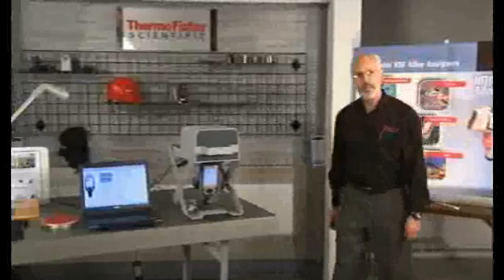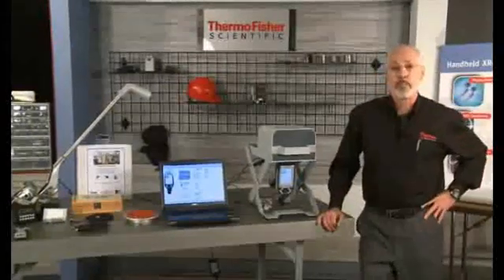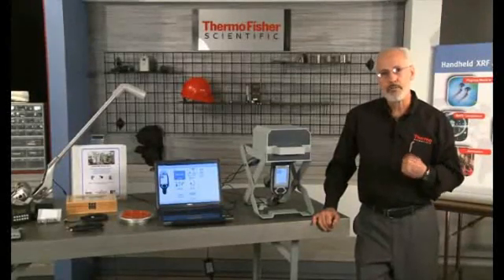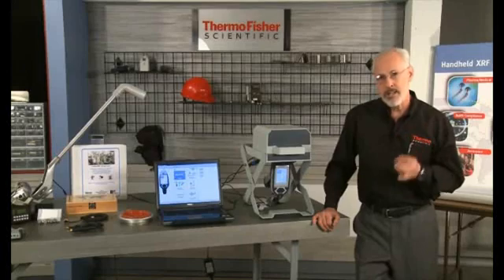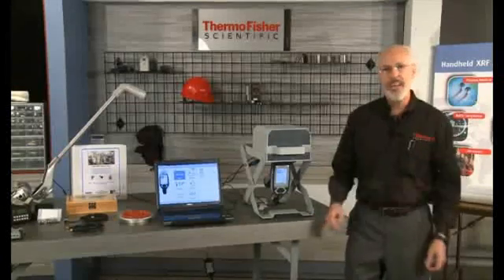Welcome to Module 4, PMI Training and Accessories. The requirement for positive material identification, PMI, of alloy materials in refinery systems and petrochemical plant operations has grown dramatically over the past 20 years. This requirement has been driven by the loss of plant equipment and production, along with loss of life, as a direct consequence of having the wrong material installed in a process plant.